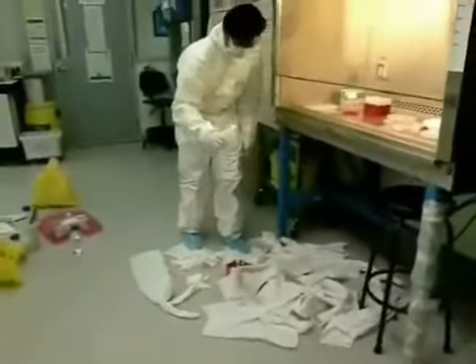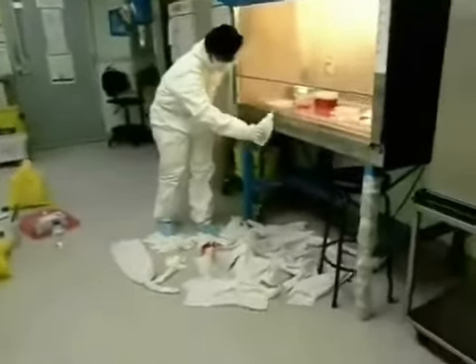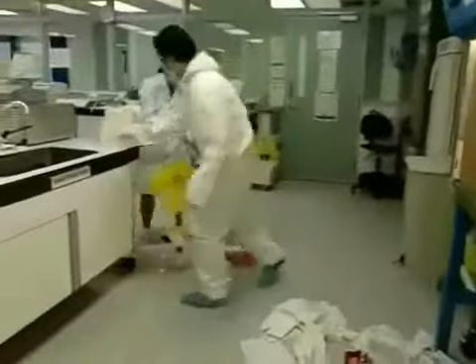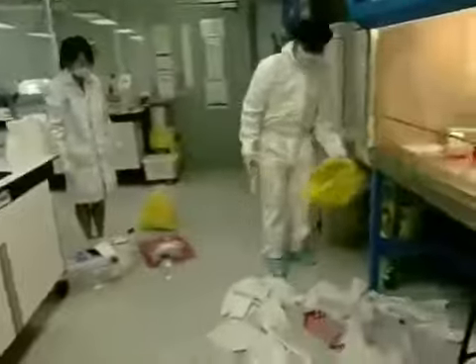Michael, are you spraying the disinfectant? It's too high — spray it at a lower height. It's incorrect to spray from the middle to the edges; it should be from the edges to the middle of the spill. Remember to allow 30 minutes of contact time.